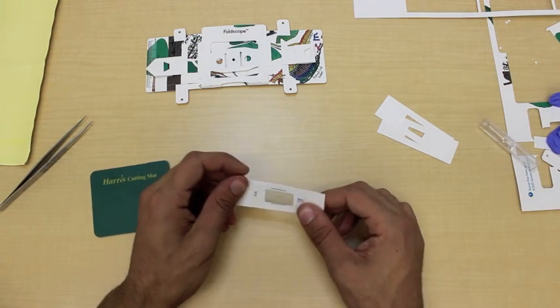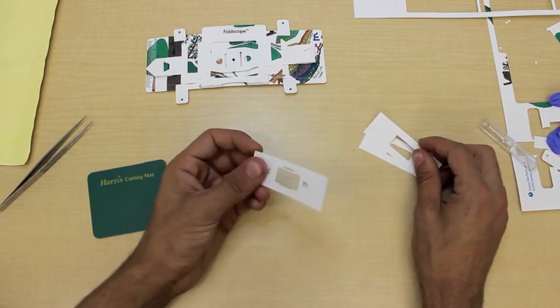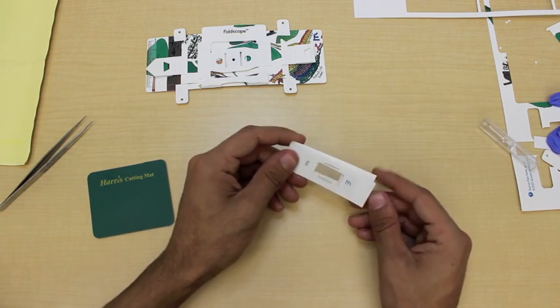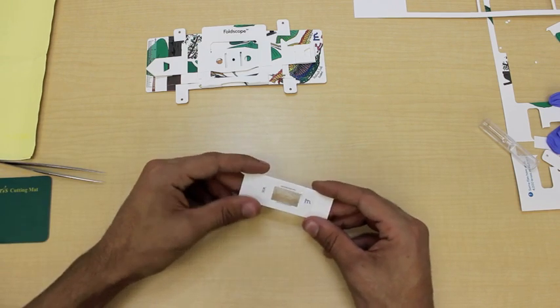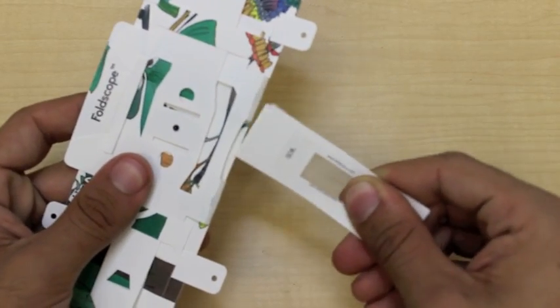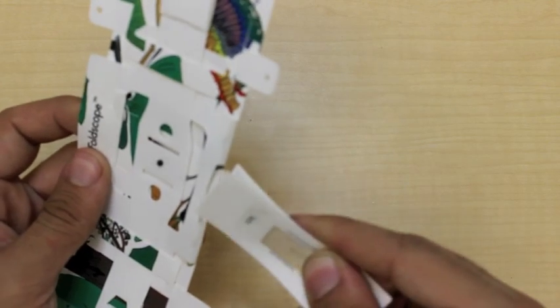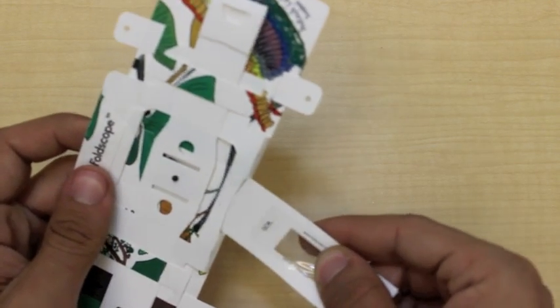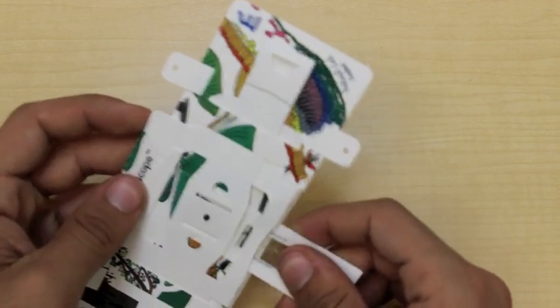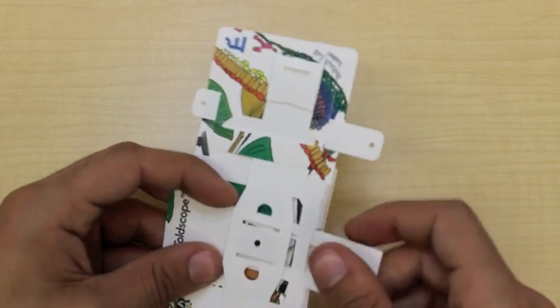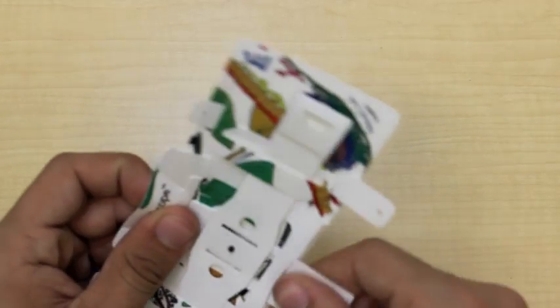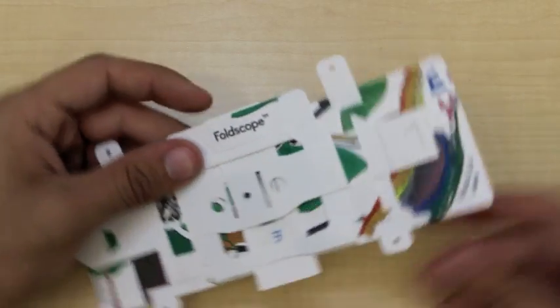Now, with our original sample, we can insert this into the slide by stacking it on top of two empty slides. This makes it thick enough and rigid enough to be viewable in our foldscope. Then, we insert it the same way we insert a glass slide. It needs to go in through this hole, and make sure you get all three pieces through. Make sure it doesn't get caught on the lens, and then insert it through the slit at the top. And there we go, it's ready to view.